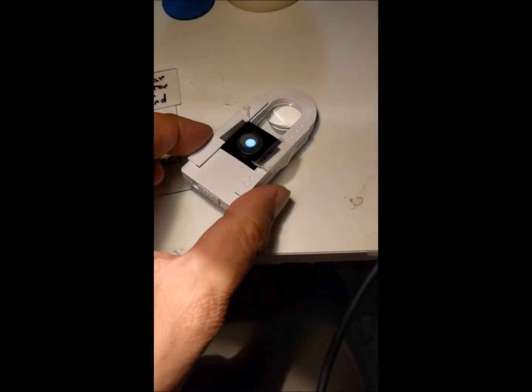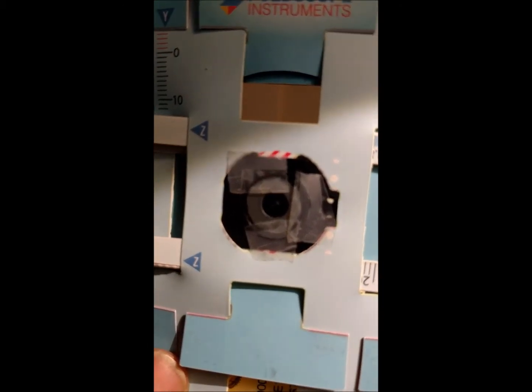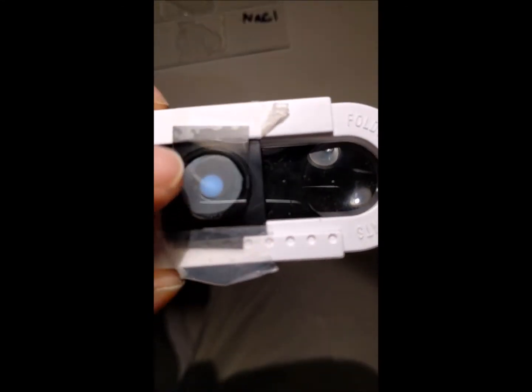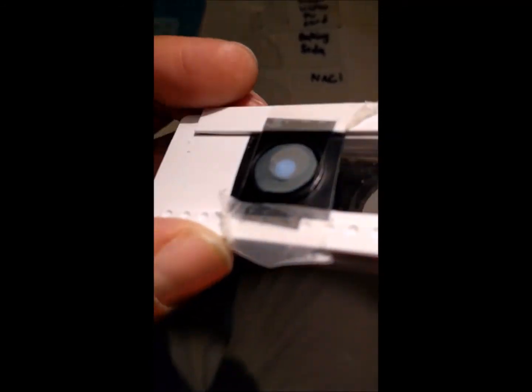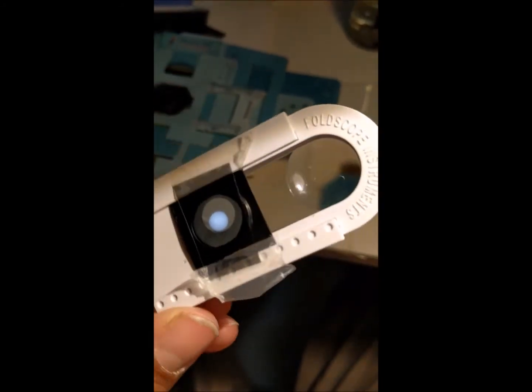Let's see what we get when we look at this under the polarizer and how we set it up. The polarizer is on the light source, which goes under the Foldscope, and the analyzer is a small piece placed on the Foldscope eyepiece. The cool thing is the Foldscope's circular magnets let you rotate the polarizer on the back to get various angles.